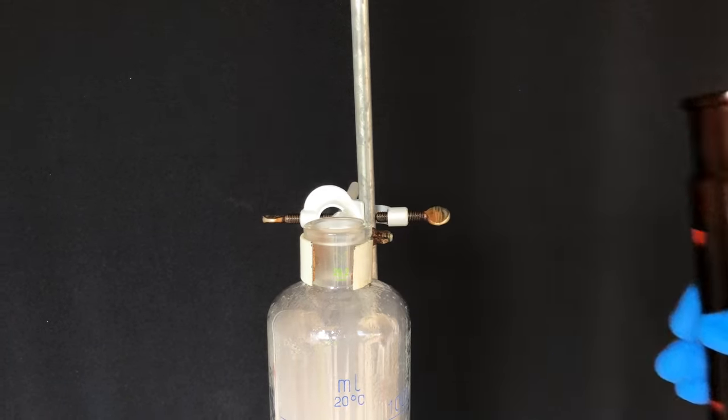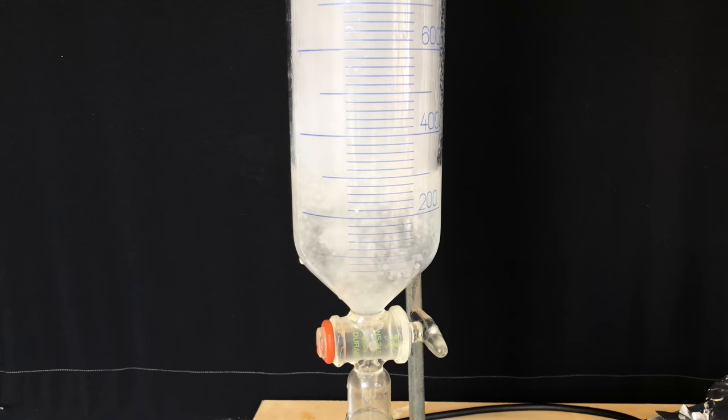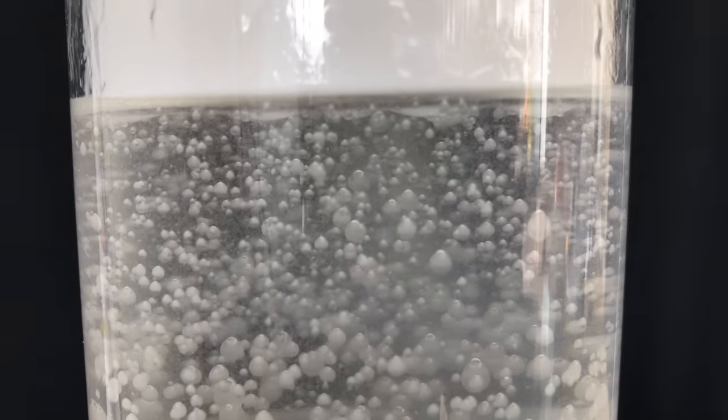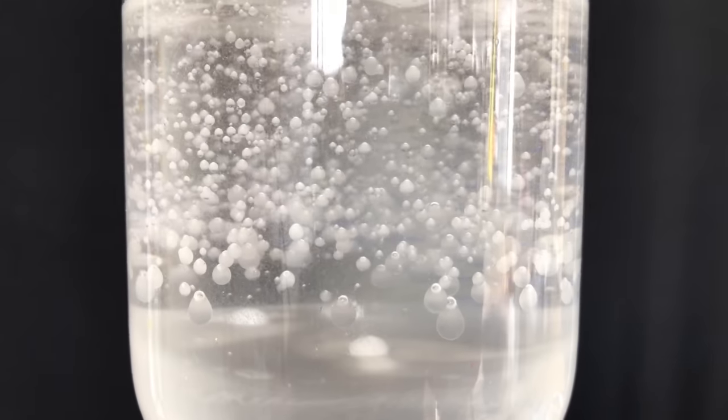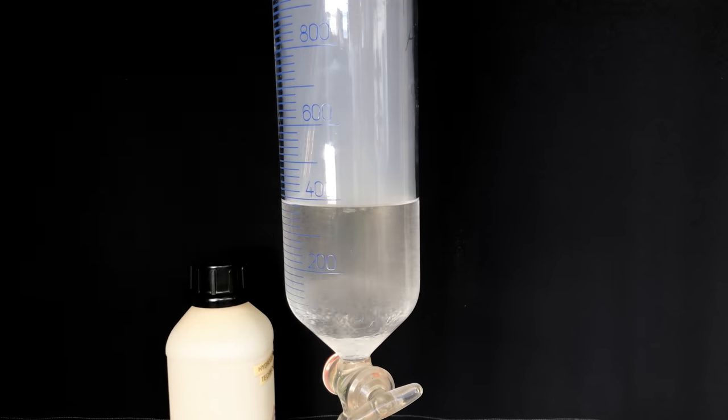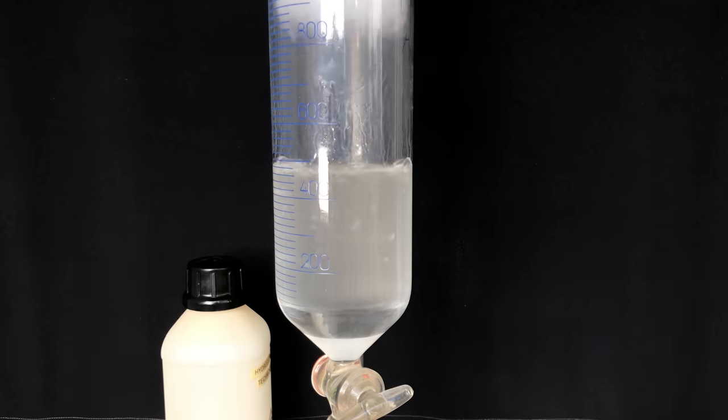To make the desired sodium salt of tropic acid, the dichloromethane solution was added to an addition funnel containing more or less concentrated sodium hydroxide solution. The funnel was allowed to stand with occasional shaking for 3 days. We even got this cool lava lamp-like effect. If you listened carefully, you know that we are left with the sodium salt of this acid. To freebase it, we added hydrochloric acid until the solution was slightly acidic.